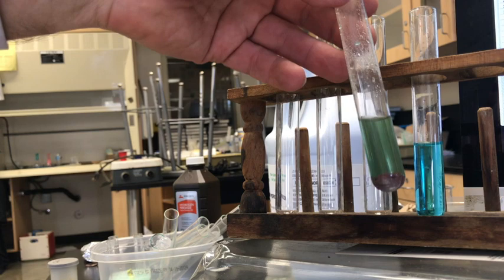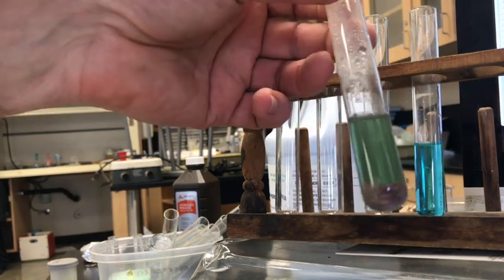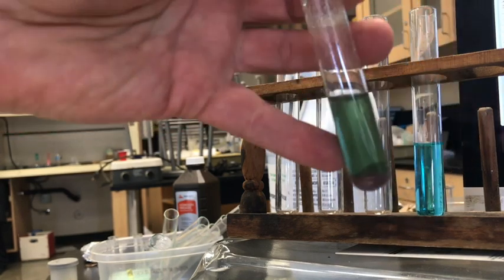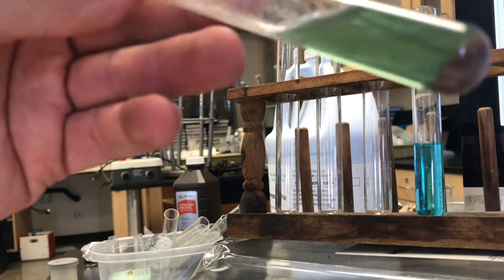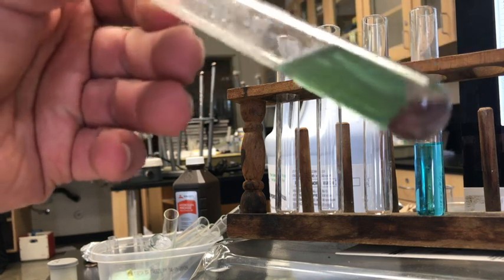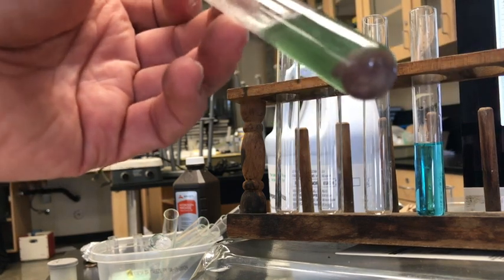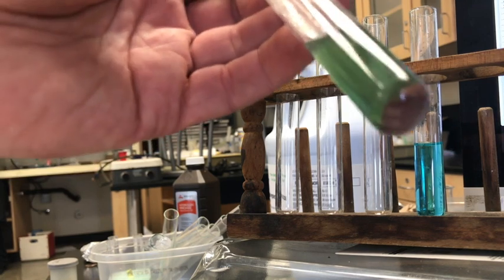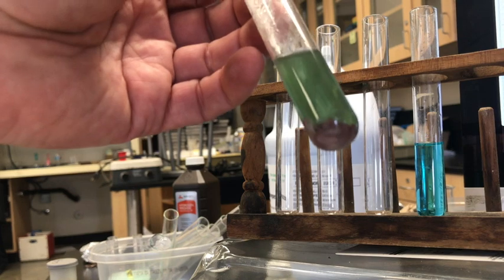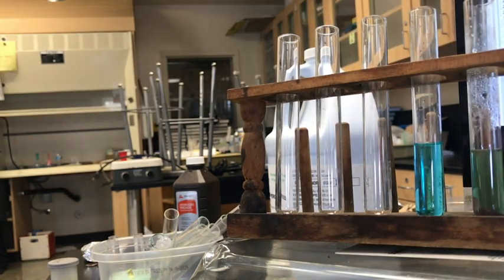Here I clearly went from this light blue of my copper chloride to a greenish color, and at the bottom I have what looks like moss, and it's sort of flaky and brown to brown-red in color, which I'm sure is hard to see in the video, the exact color. So we got that, and let's see if that would still react.